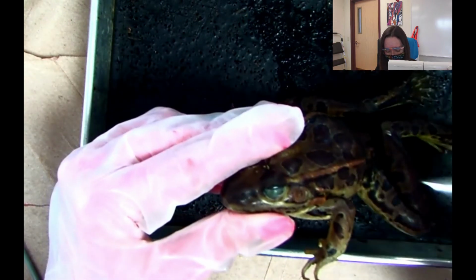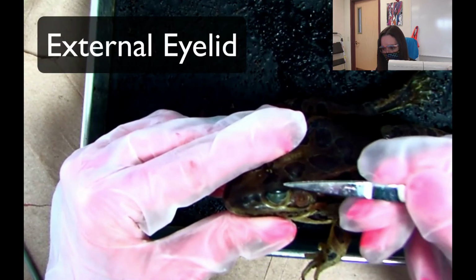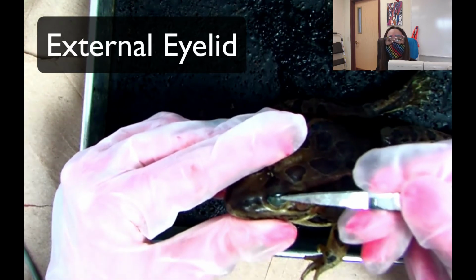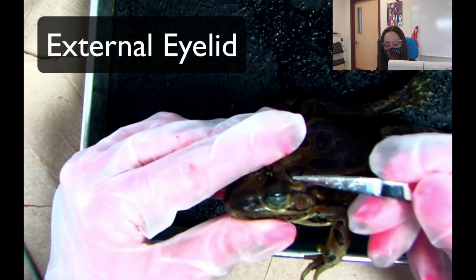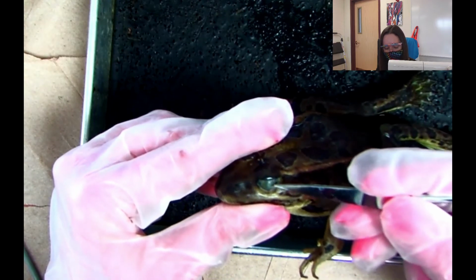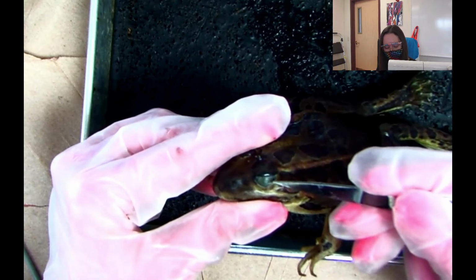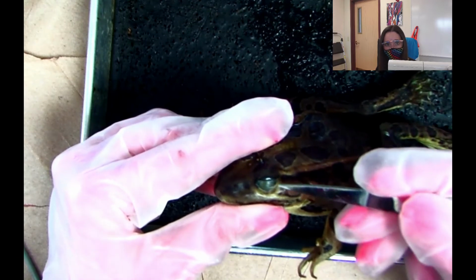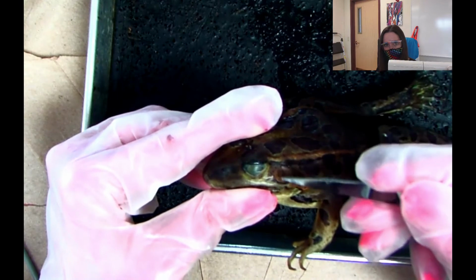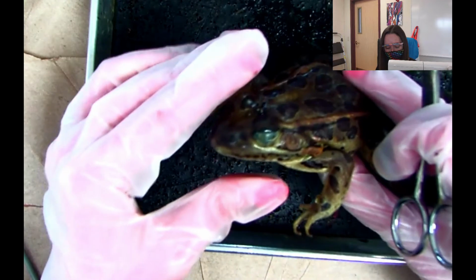The next thing that I want to talk about is the external eyelid. The external eyelid is just the top right here, just above the eye. The one thing that's easy about this quiz is it will be multiple choice. So it'll be really easy when I point to this and say, okay, what is this structure? Number 2 is this structure. So you'll just have the multiple choice question. We're going to do the quiz over the document camera. So I'll be like, number 3 is this structure. It's the circular structure right here. Or Mr. Tricky would do the same thing. And so you'll need to know all these parts.